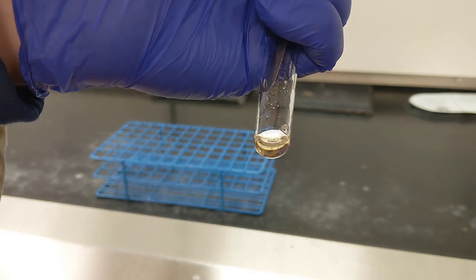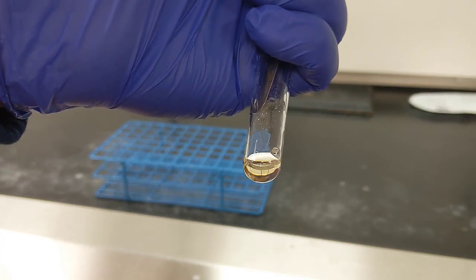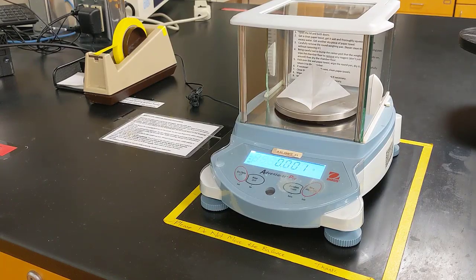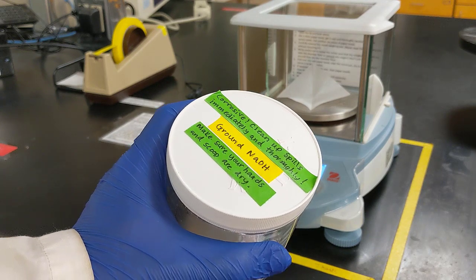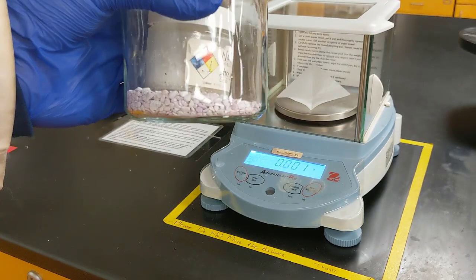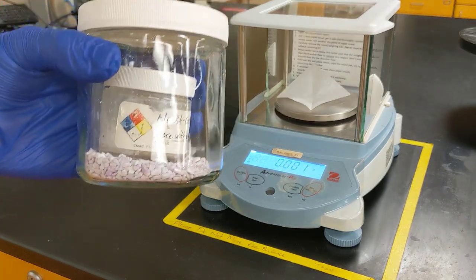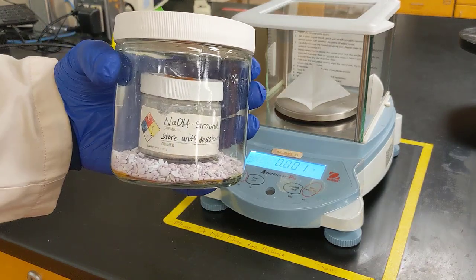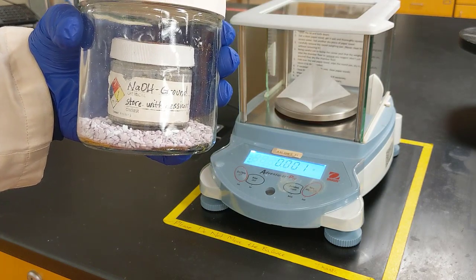The next thing I need to do after I've created that oil is to add my sodium hydroxide. So let's go ahead and measure out our sodium hydroxide. Alright, so the sodium hydroxide we're using is ground very finely, so we have to keep it in this desiccant chamber to prevent any of the moisture in the air from getting absorbed into our sodium hydroxide. Sodium hydroxide will actually react with the CO2 and moisture in the air and neutralize the carbonic acid that's formed.